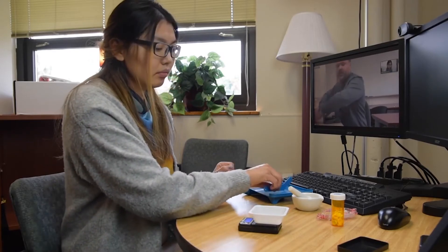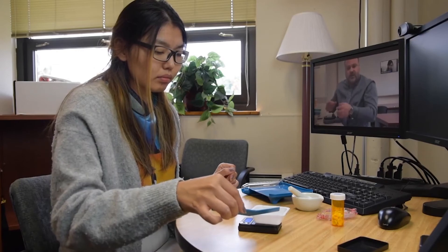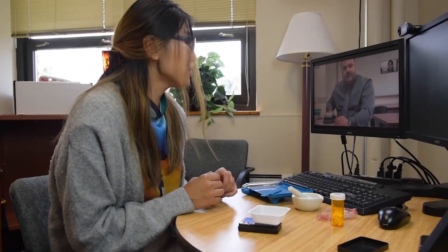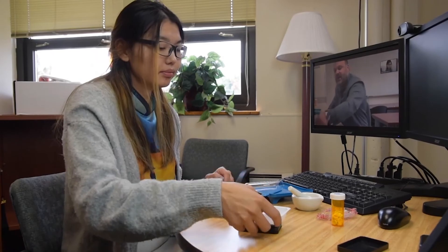And now we're going to want to read the weight of our powder and then document it in our compounding log. So what's the weight of your powder? 2.8 grams. Okay. So we're going to document that in the compounding log, and we're going to set aside our powder and we're going to prepare the rest of our items.